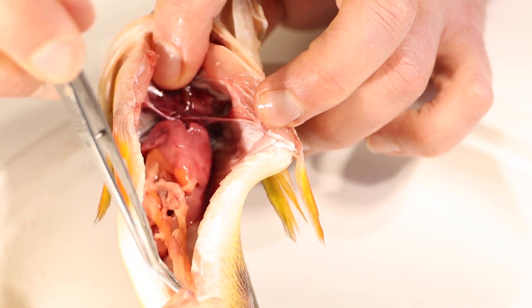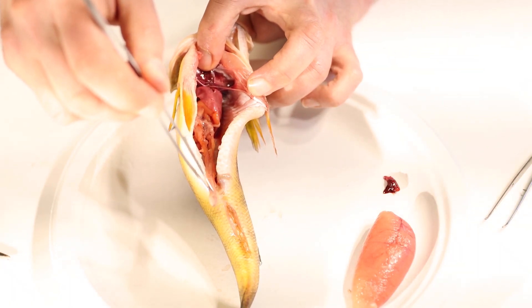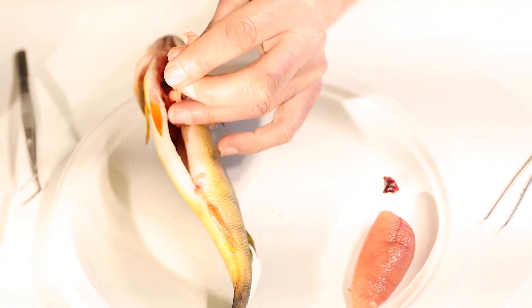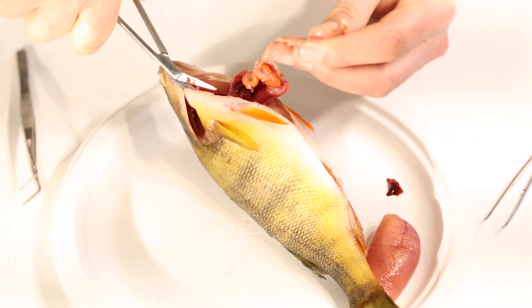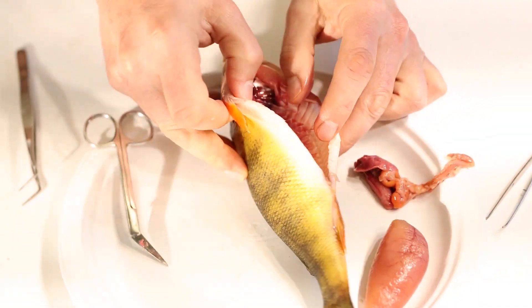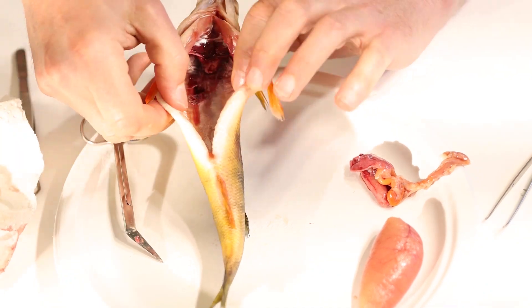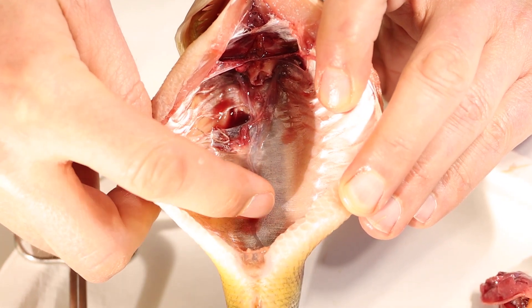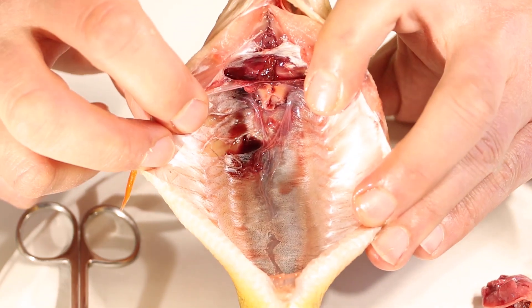Then whatever waste — fish poop — travels down the large intestine and leaves right through the fish's vent. We're going to cut all of these organs out to get a nice clear view inside of the fish. We'll get rid of some of the blood and liquid in there. And you see this shiny layer that almost looks like skin? It's a membrane inside the fish, and it's called the fish's air bladder.